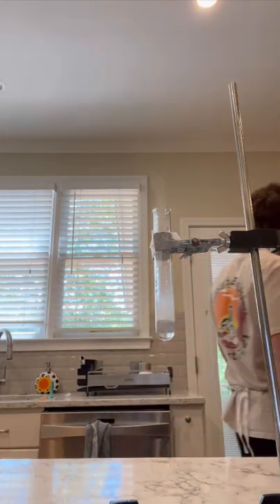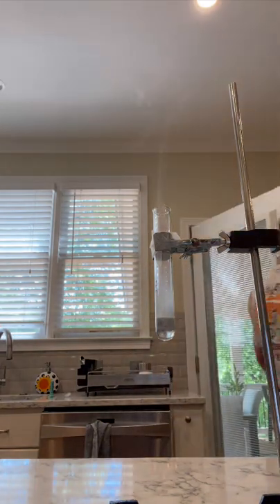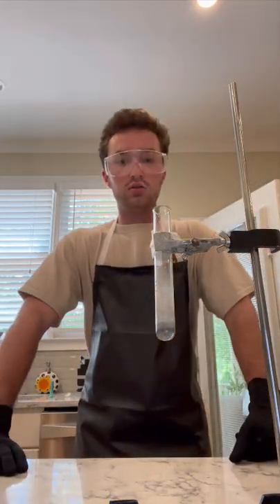Open this door. Ventilation. Oh yeah, there we go.